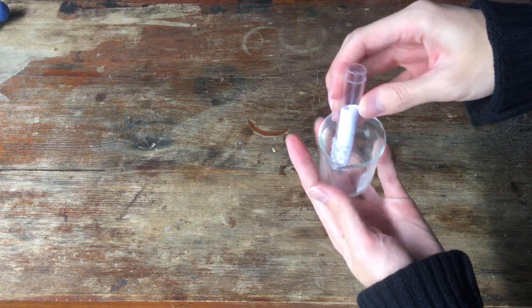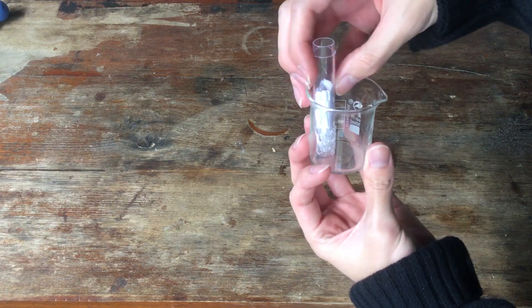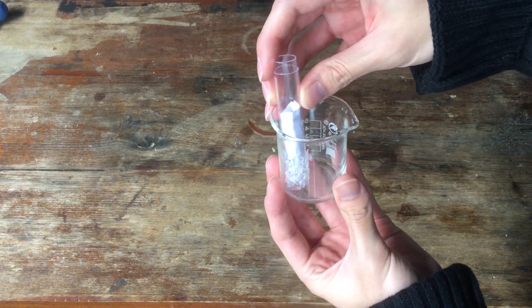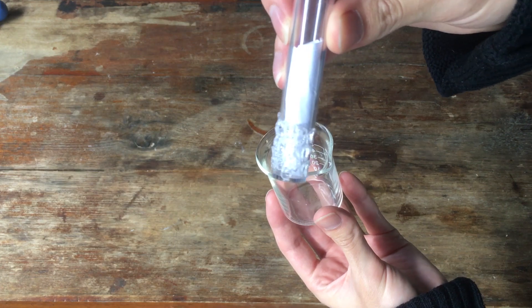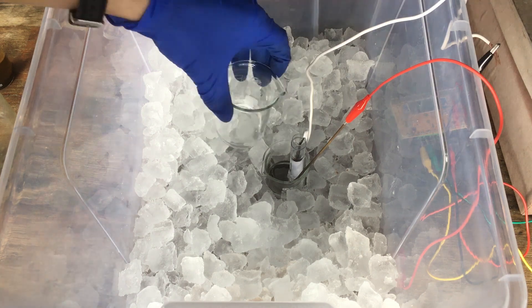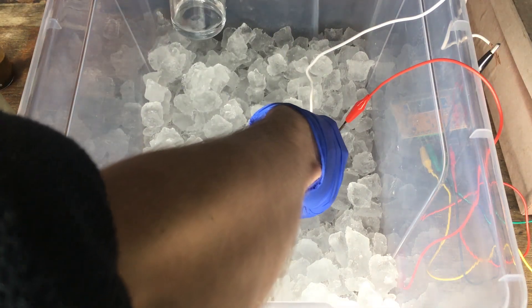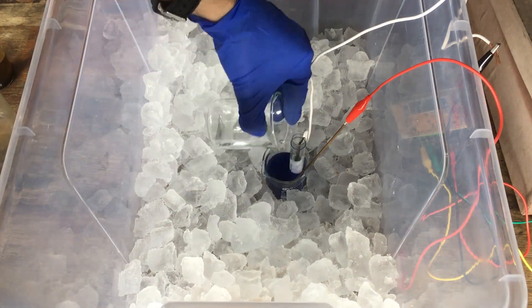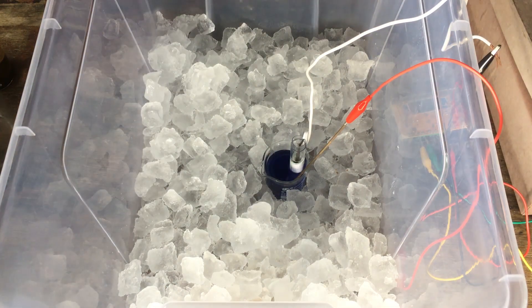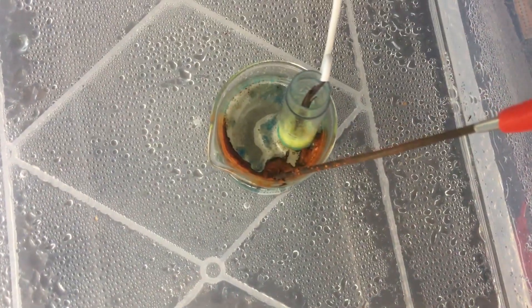The only real option here is to completely start again, so I get some new ice and set up a new cell with a much smaller volume and a much smaller cathode compartment, which I've made out of a small plastic tube. We set up the cell to run with approximately 40 to 50 milliliters of solution rather than 400 milliliters, and we only add around 3 grams of potassium hydroxide rather than a full 40 grams. We run the cell exactly the same way that we did previously.